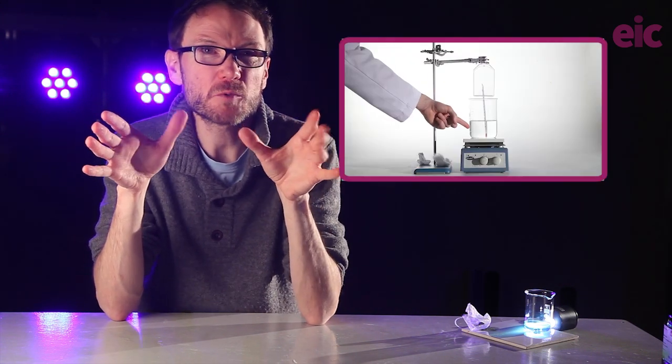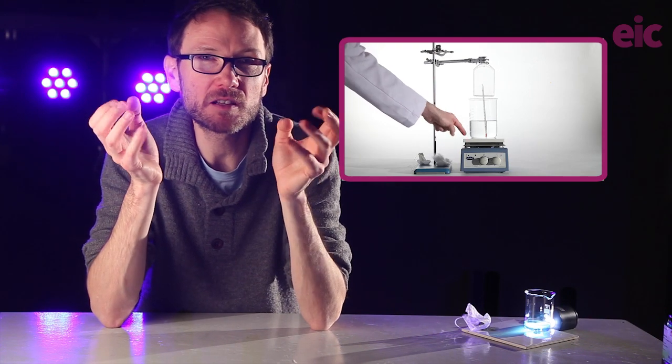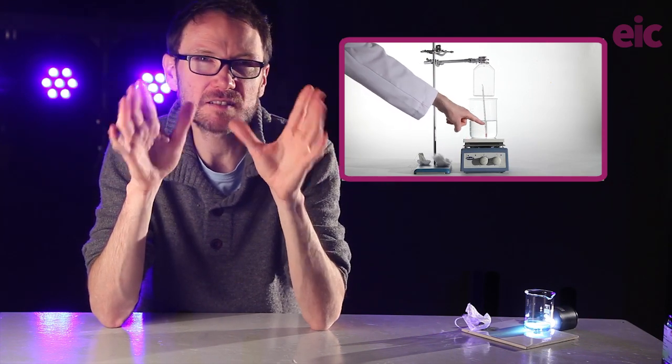If you skipped past all of the other stuff in between, I don't blame you. Just know that there are reasons for what we're about to do and the way that we're going to do it. I have a 1 litre borosilicate beaker ready with some water on a hot plate below somewhere around 80 Celsius.